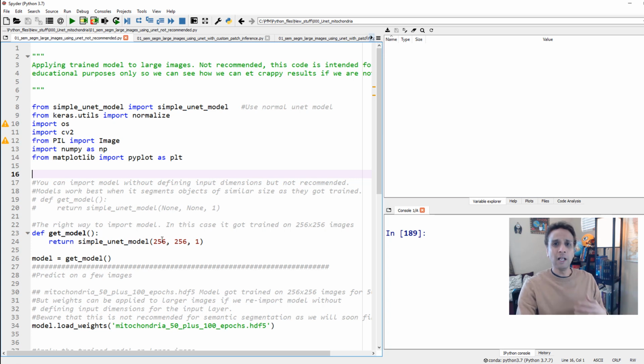Now the question is, my image that I want to segment is 768 by 1024. It could be much larger if you're working with whole slide imaging in bioimages, for example. These are humongous, right? You cannot just train your network on these large images. You have to train them on smaller patches, whatever the logical patch size was. So in our example, we trained it on 256 by 256 size images. These are grayscale images. My model expects 3 inputs, height, width, and number of channels, right? In this case, number of channels is only 1.